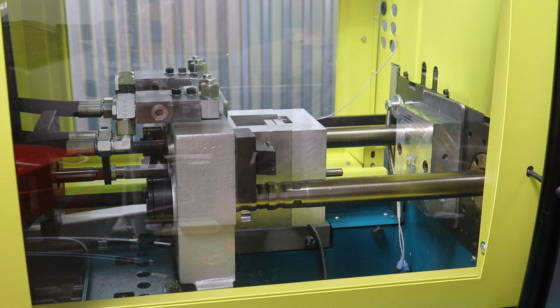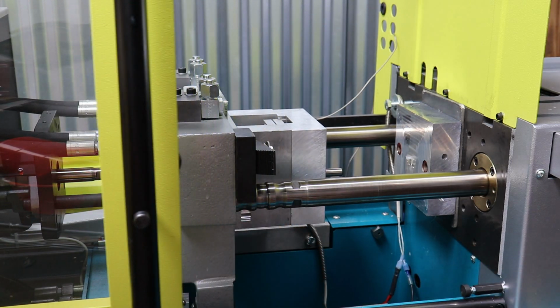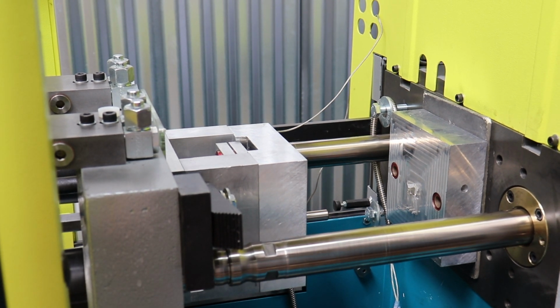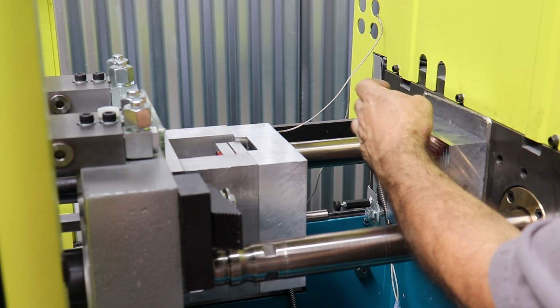Okay. So the part's stuck on the A side. I don't know if you can see that. And it's got all the usual first shot kind of oily mess on it. But what I need to do next is cut an undercut into the sprue puller. This is a process that I do basically for every new mold, and you want to balance the retention force of the part so that it comes out at the right point.